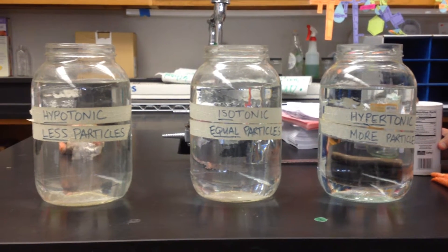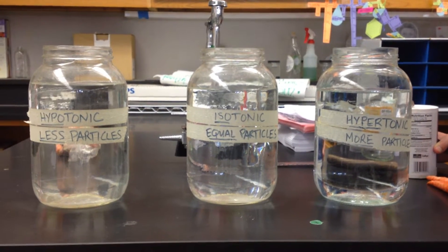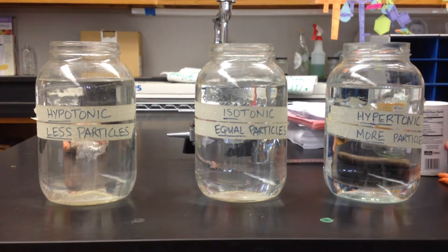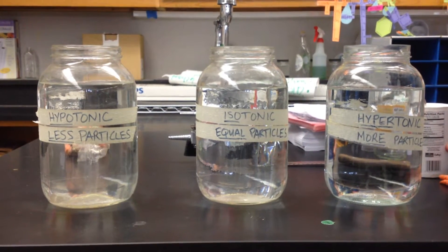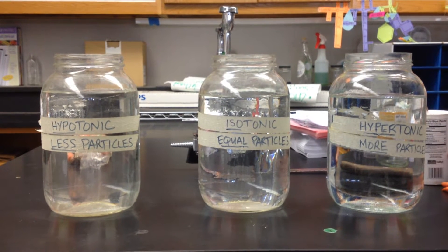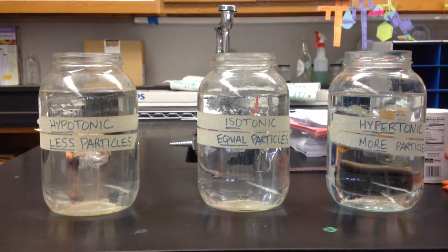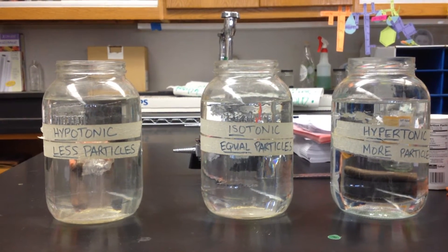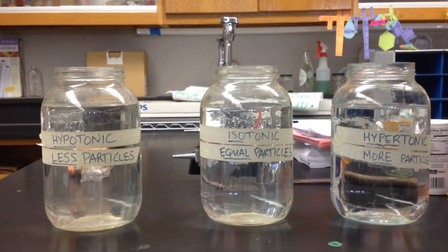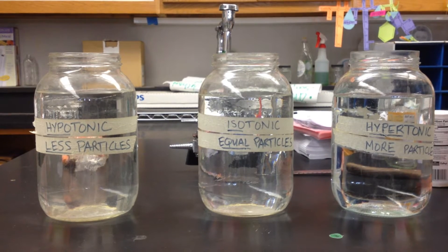Here we have three containers, all filled with just classroom tap water. You'll notice that there are labels on each of the containers. The first one says hypotonic, which means low particles dissolved in the water. The only particles in that water are any of the stuff that may have come out of the faucet — we're not going to add anything to that water.